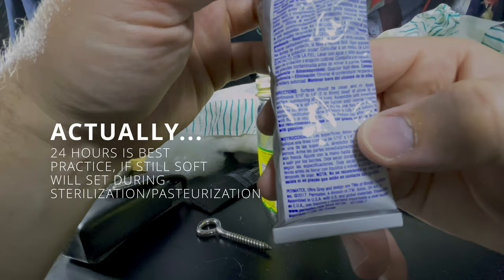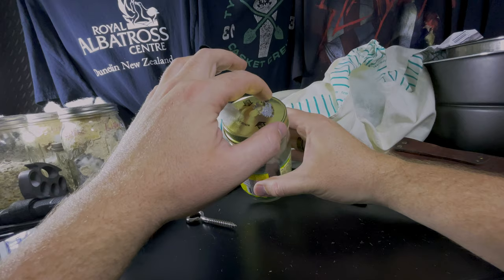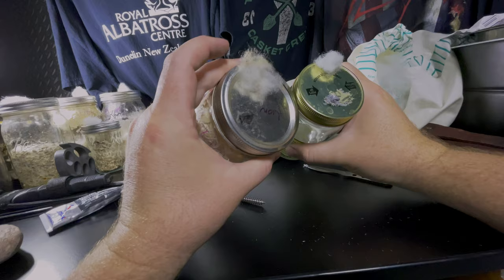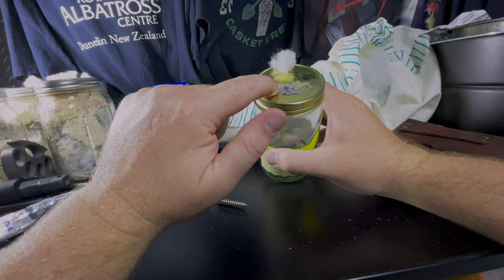So I've let it go as little as just until I can touch it and it's not tacky. So this is an example of still tacky. This is not. But once you can touch it and it's got kind of a skin, it'll lose its shine. It'll start to look kind of faded, like these. You can see one's kind of wet looking, the other looks drier. So I've actually put them in the pressure cooker while it's still a little soft on the inside and dry on the outside. And I've had no issues. So you don't even have to wait for it to fully dry.